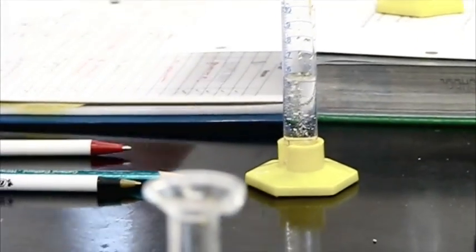Two scoops. But because the cracker is all on top, I need to mix it. I'm going to take a pipette and I'm going to froth it up. I'm going to mix it in so that the amylase and the lipase can do their job.